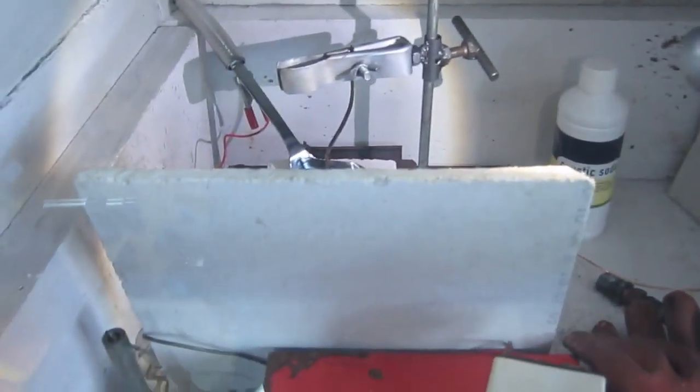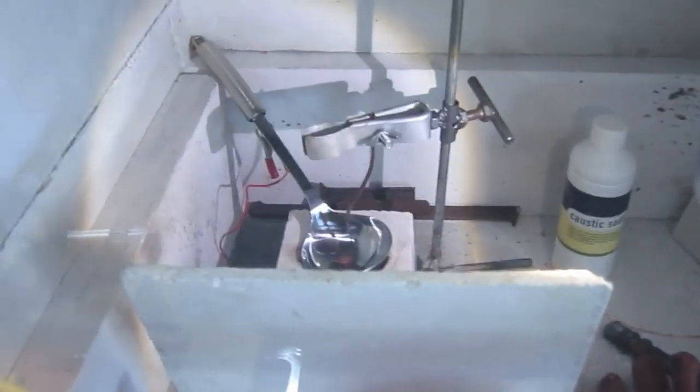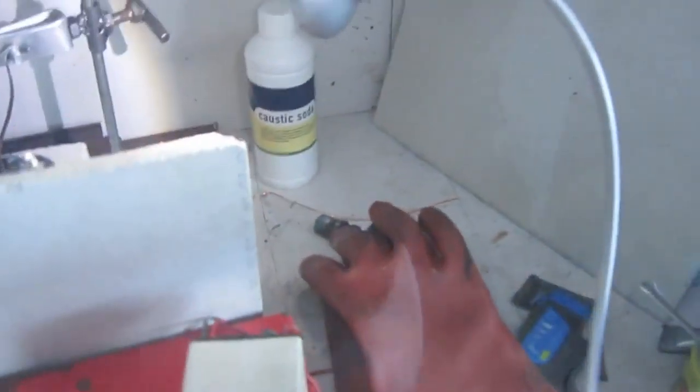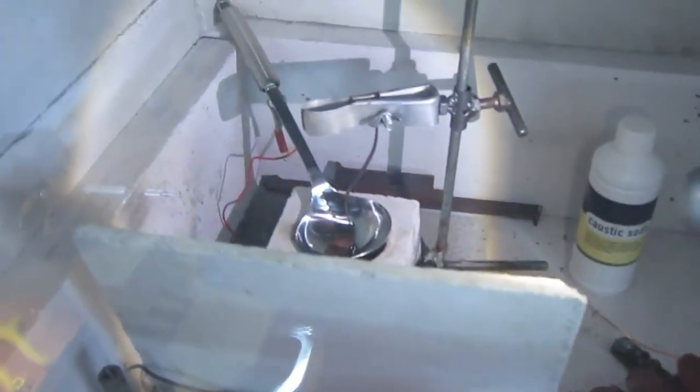Normally when I do this, I work behind Lexan, so it's safe. But when you don't do this, always use a face mask and use gloves to handle the NaOH. Okay, I'm going to fill the crucible and then heat it up until it melts.